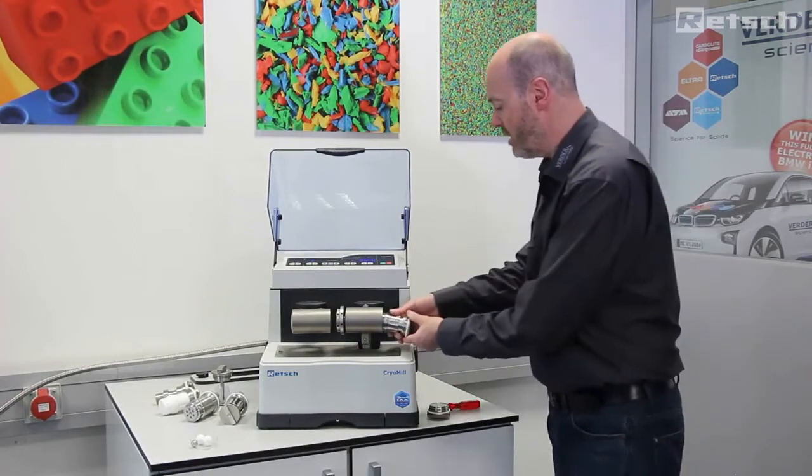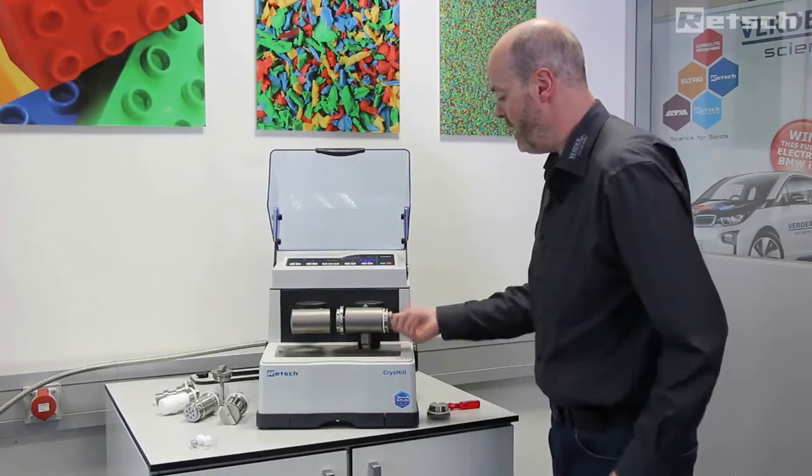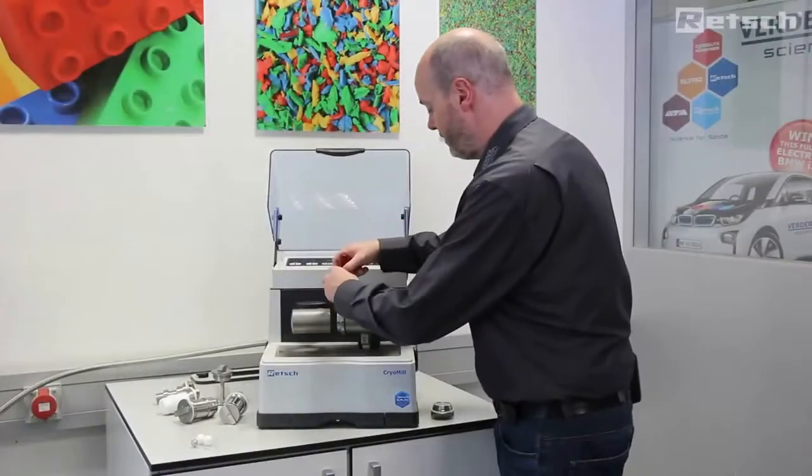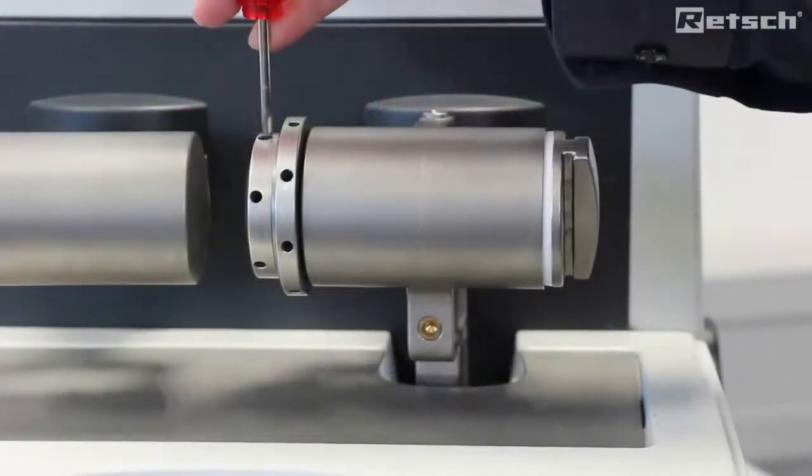The jar can simply be inserted, tightened, and with the tool provided, securely locked.